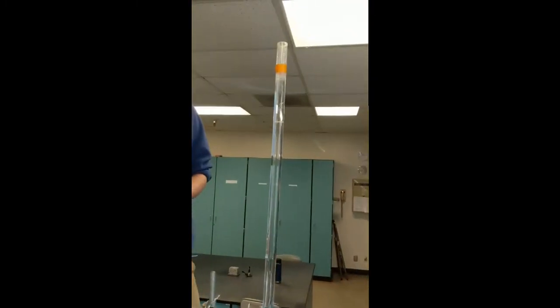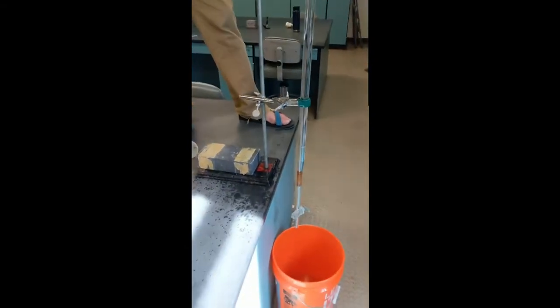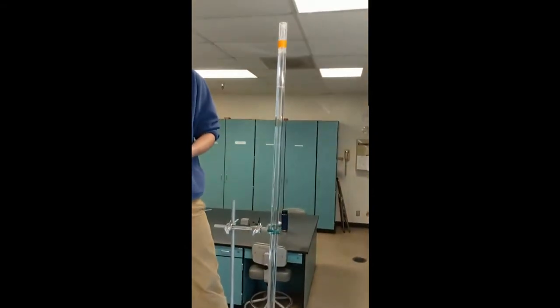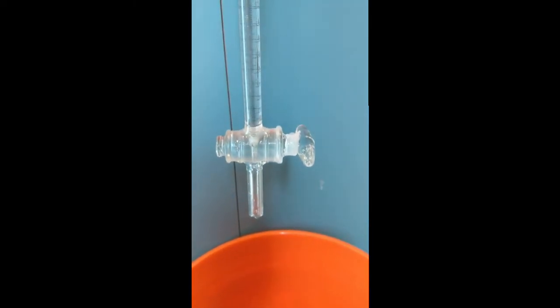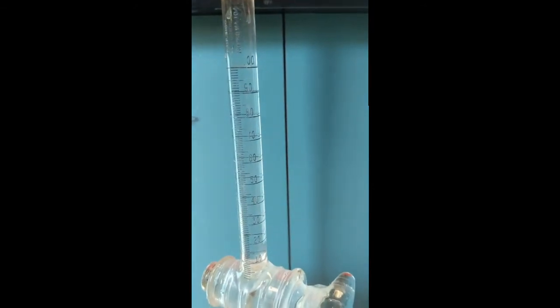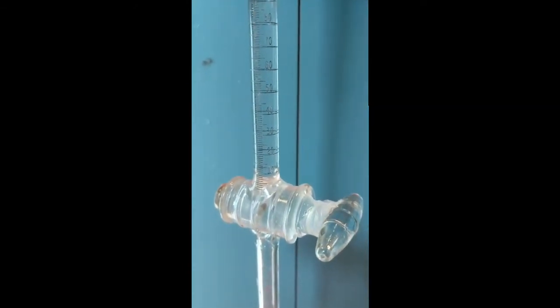This is called an emery settling tube. And it's a very, very long tube. We filled it with deionized water up to the top of this tape here. At the bottom of the tube, you can see we've got a stopcock and we've got a scale. It might be a little difficult for you to see, but you can see that we've got basically a graduated cylinder at the bottom of this tube.